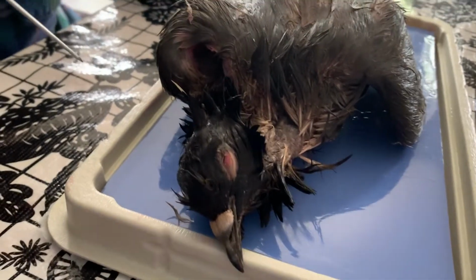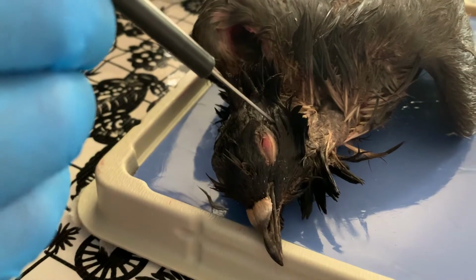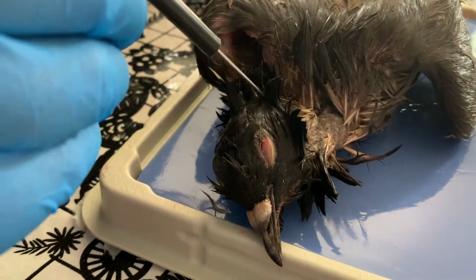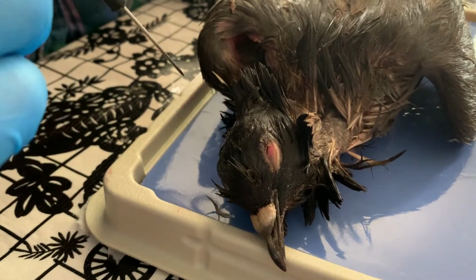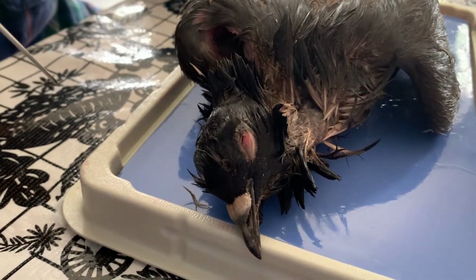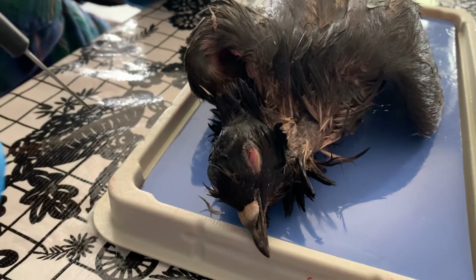All right, birds have ears. These are external openings that are posterior to the eyes. These ears are covered by feathers that are called coverts. Okay, so with the feathers on, they're kind of hard to notice. Different birds have different adaptations having to do with the sizes of their ears.